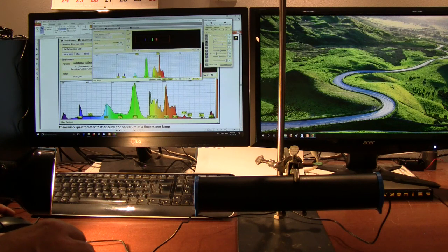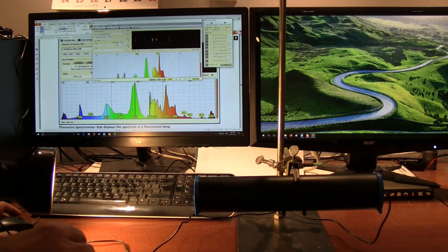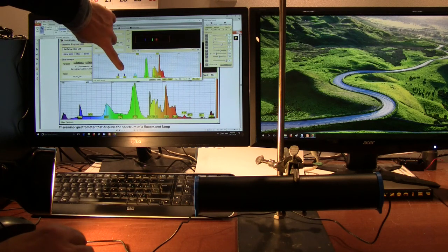But when we want to trim it, there's a trim button right here that allows us to adjust the scale. So you can see that these markers come on when you click on it, and then you can drag them in different directions to increase or decrease the width of the scale to bring your calibration lines into the correct point. So we want our blue line to be around 437, so I've adjusted that one.